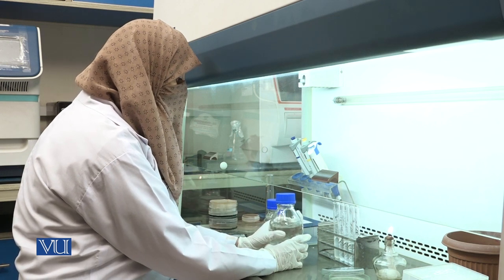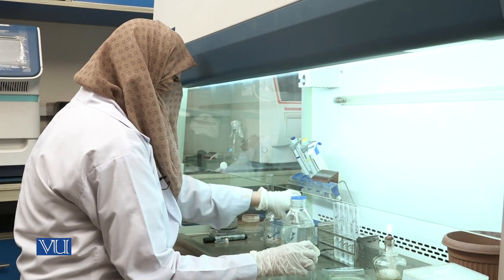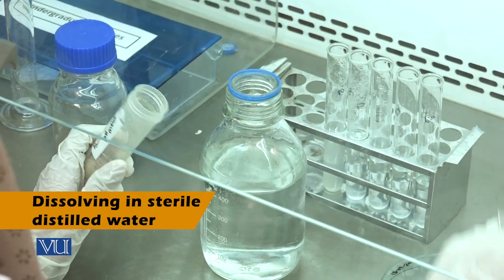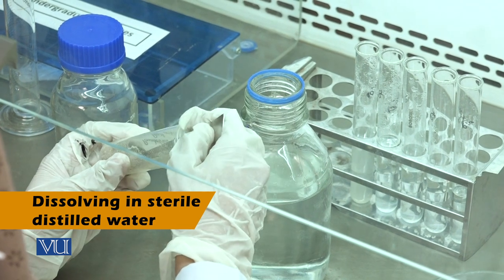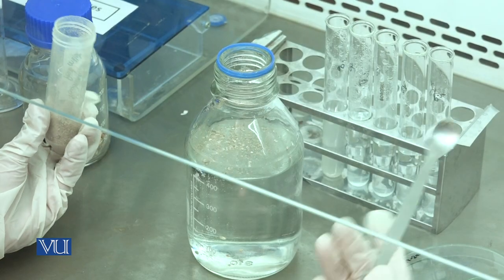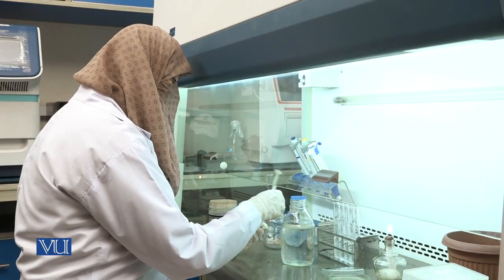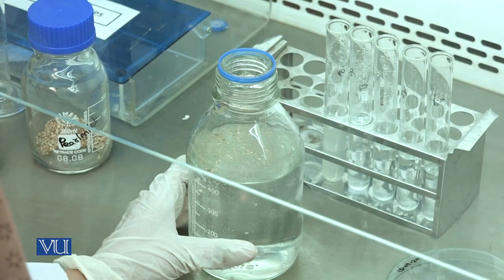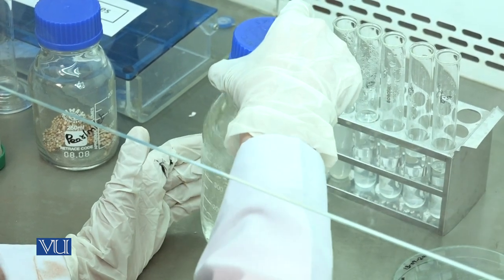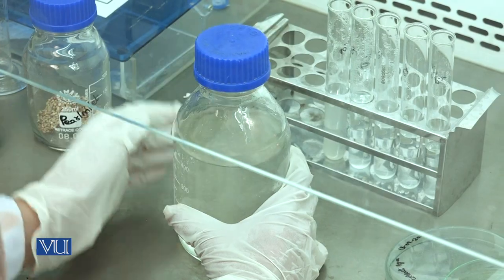This is sterile distilled water. Take 5 grams of powdered pearl millet and add into the sterile distilled water. Mix it properly and place in incubator for 7 days for fermentation.